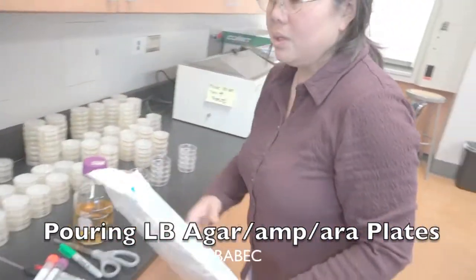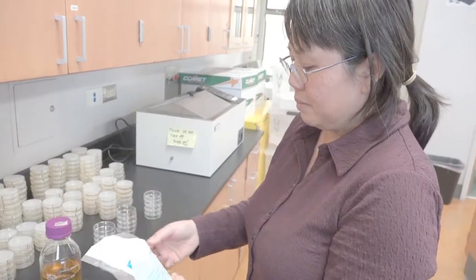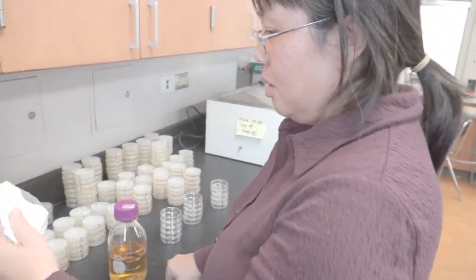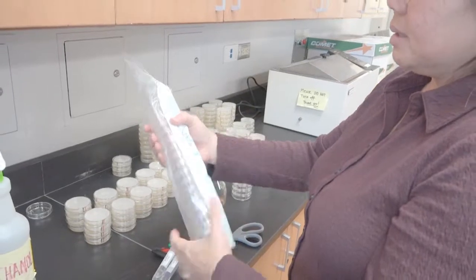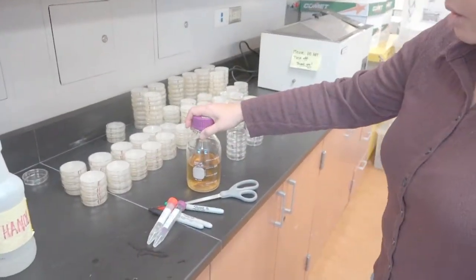Today we're going to pour LB Amp Arabinose plates. We have our sleeve of 20 plates and our LB agar ready.